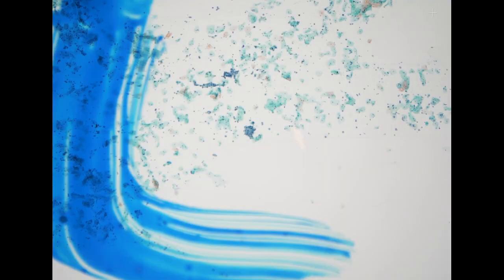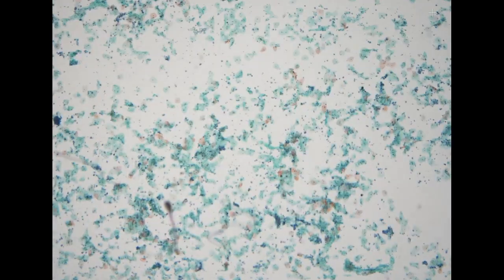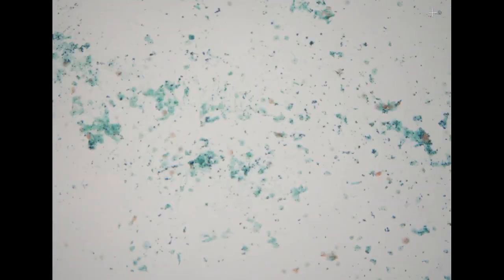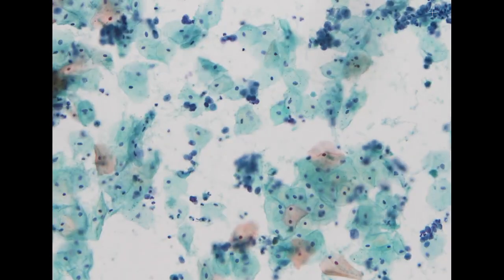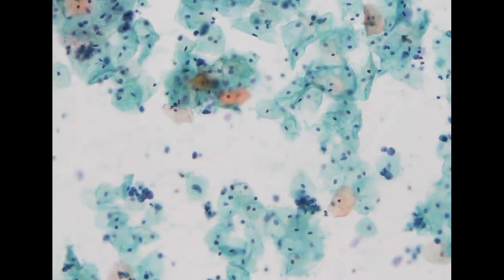So in this specimen, we know we have a carcinoma, and it is likely located at the vagina, which is the sampling area. Hence, we get tons of carcinoma cells in this specimen. So we call this positive for carcinoma. And because the patient already had a biopsy, it is compatible with the biopsy diagnosis.